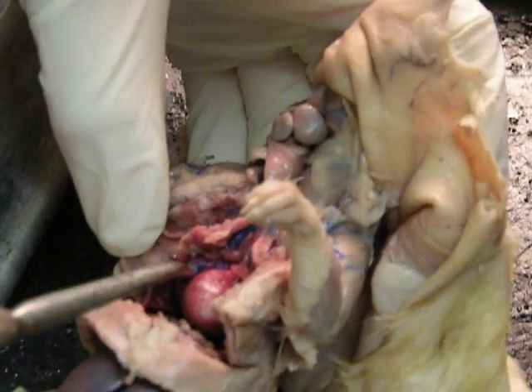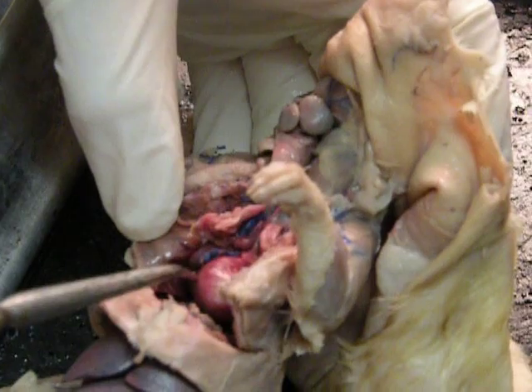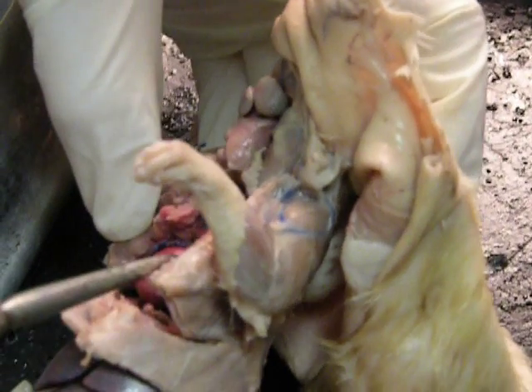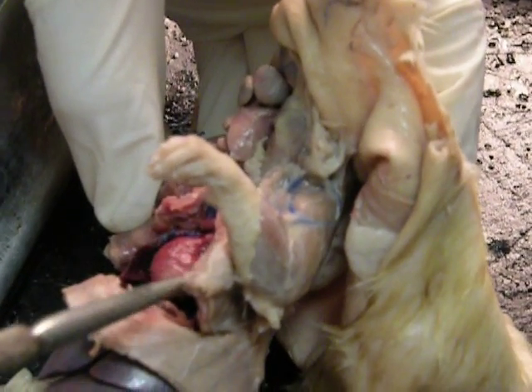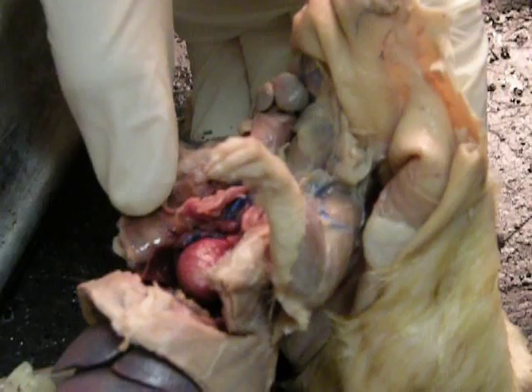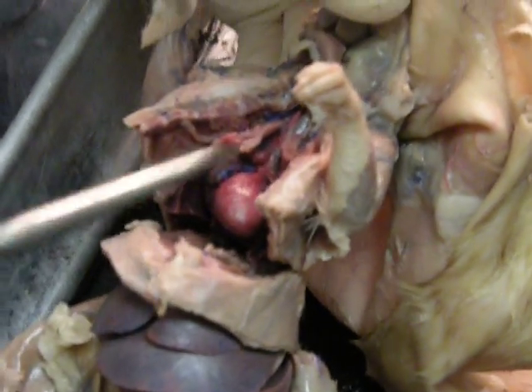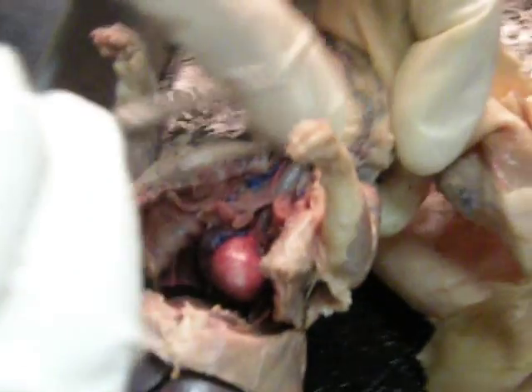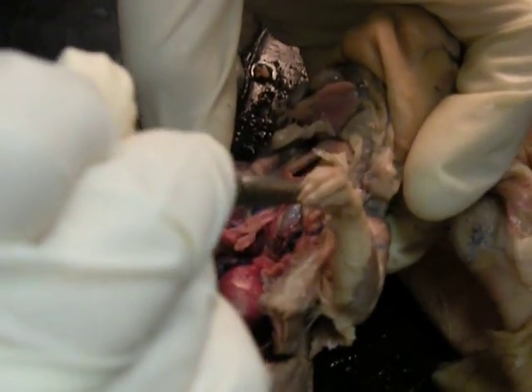This will be the right atrium and right ventricle, and then over here you have your left atrium and your left ventricle. This is your diaphragm right here.